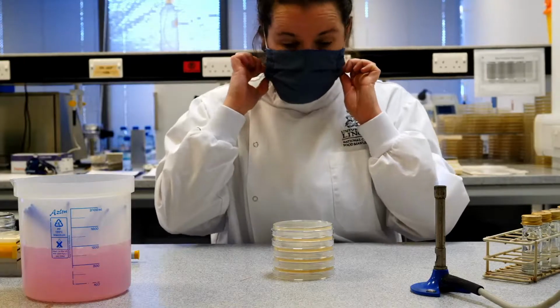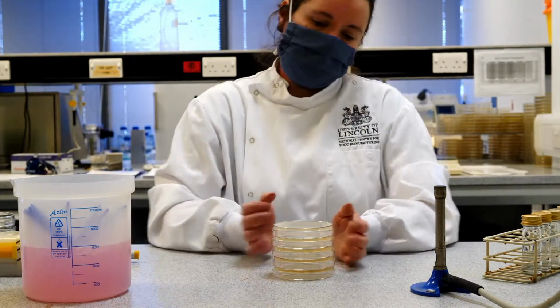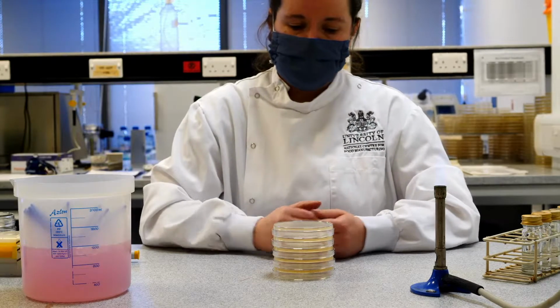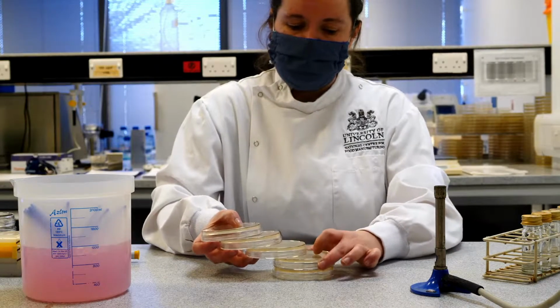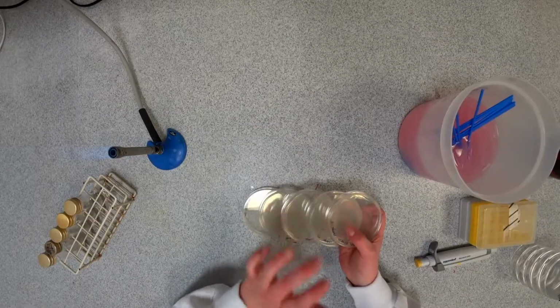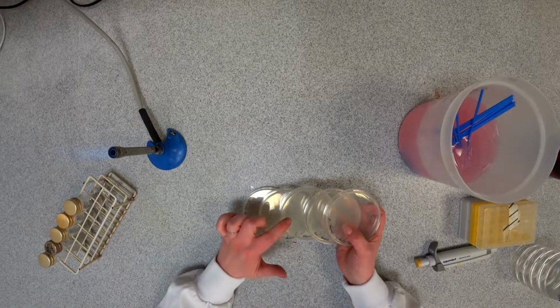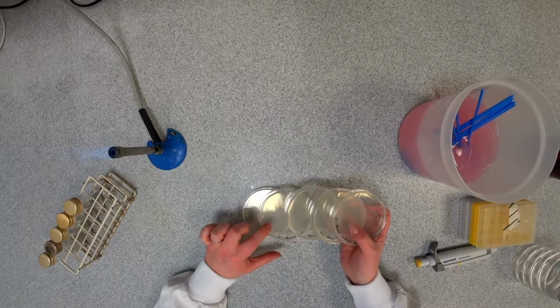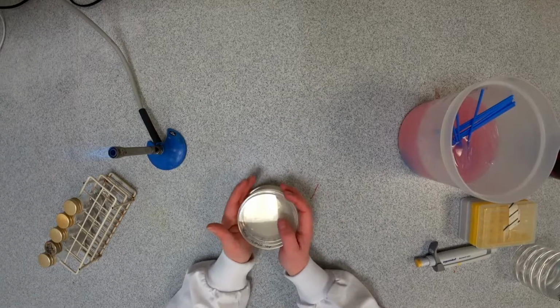So those are all set and finished now. What we'll do is put those in the incubator, which is in the other room a bit later on, and then we can have a look at those in about 24 and 48 hours to see what we have growing on them. And of course, as I mentioned earlier, what we're hoping to see is a dilution where there are 10 times more bacteria as we go up through the dilution series. So if we see, say, one organism on the 10 to the minus 5 plate, we'll expect to see 10 on the 10 to the minus 4, 100 on the 10 to the minus 3, and then probably an uncountable number. There should be about 1,000 on the 10 to the minus 2 plate, which we wouldn't be able to count. So that's spread plating.